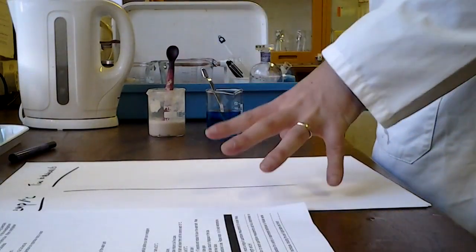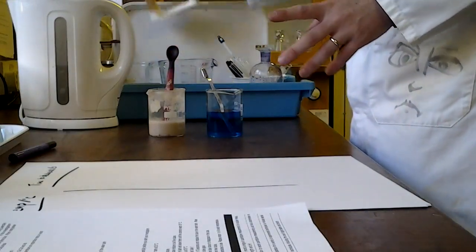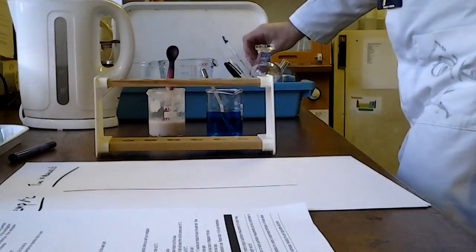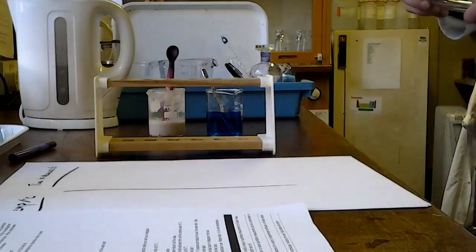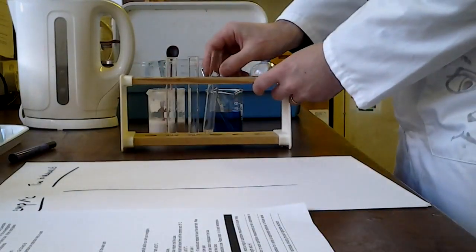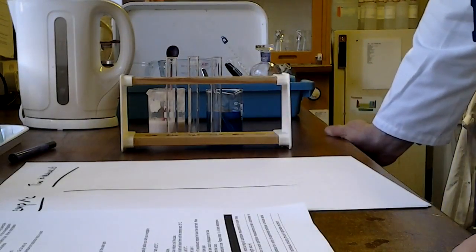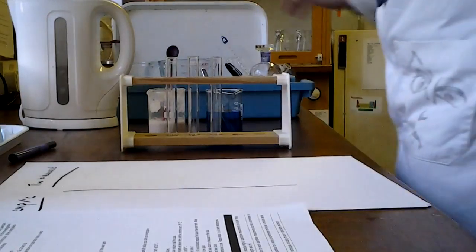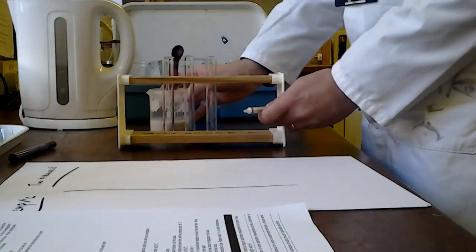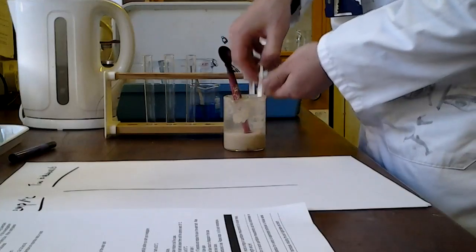Now, I'm going to demonstrate one of these, and I'm going to start at one temperature. And I'm going to leave you to think about the other temperatures you might choose. So I'm going to do the first experiment, just to demonstrate it, at 35 degrees. And the first thing that you need to do is you need to get 3 test tubes, and we are going to put 2 centimetres cubed of the yeast and glucose mixture in each. So here we go. Here's my syringe that I'll be using for this, and 2 centimetres cubed is going into each one.